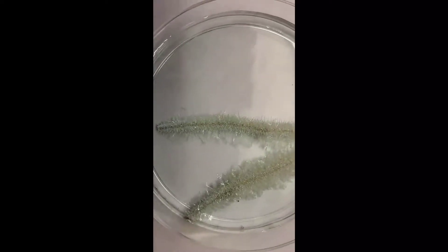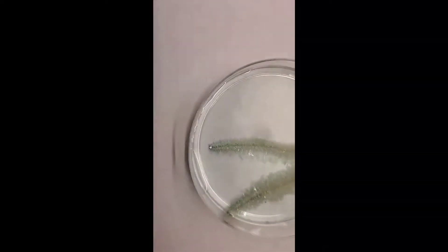I'm not sure if you can really see it well, but maybe you can see how the liquid has got a blue tint to it. What that's from is the copper ions going into solution. Solutions that contain copper are often blue or blue-green.